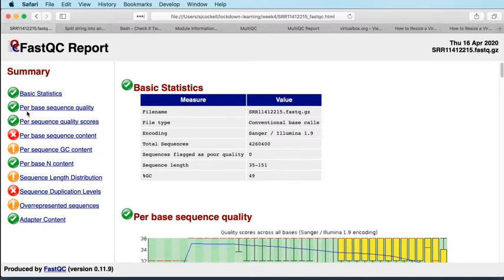Okay, so the first thing is just a table of some basic statistics telling you what the file is that you've processed, the encoding of the quality information, which we can maybe talk a little bit about in a second, how many sequences there are in the file, so just over 4 million or 4.25 million in this case. There's no sequences flagged as poor quality. They have length ranging between 35 and 151 bases, and they've got 49% GC content. So that's a useful set of kind of core statistics about this particular file. You will always get a green tick next to this one because it's not really testing anything, it's just giving you information.